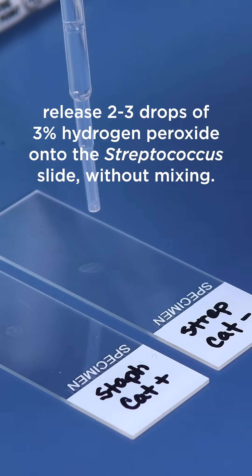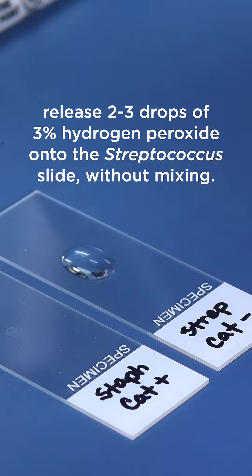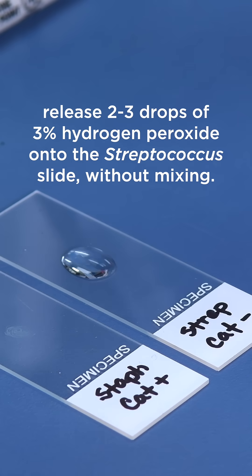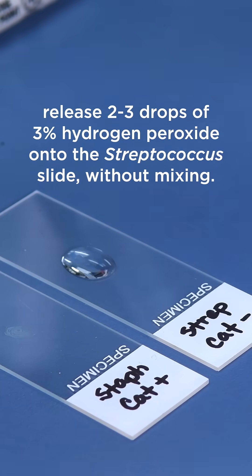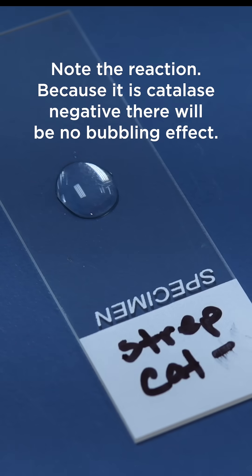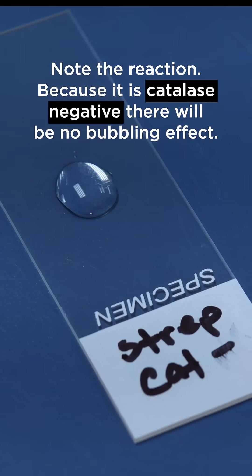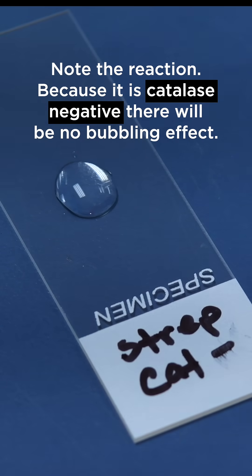Using a dropper or pipette, release 2–3 drops of 3% hydrogen peroxide onto the streptococcus slide without mixing. Note the reaction. Because it is catalase negative, there will be no bubbling effect.